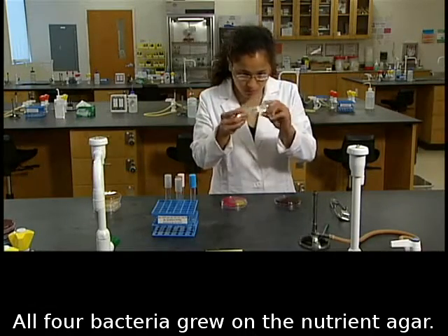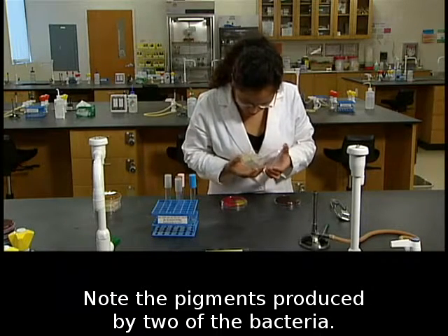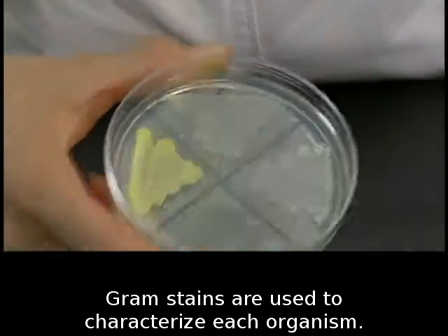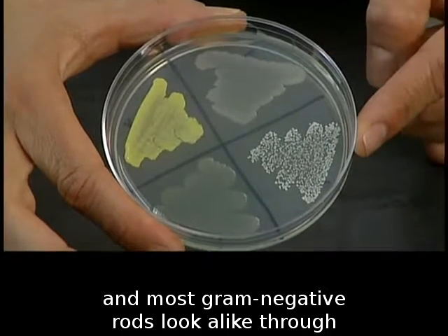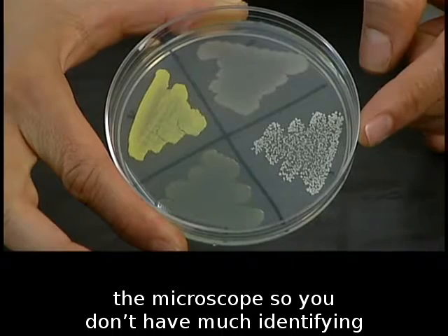All 4 bacteria grew on the nutrient agar. Note the pigments produced by 2 of the bacteria. Pigments are useful identifying traits. Gram stains are used to characterize each organism. Unfortunately, most gram-positive cocci look alike and most gram-negative rods look alike through the microscope, so you don't have much identifying information yet.